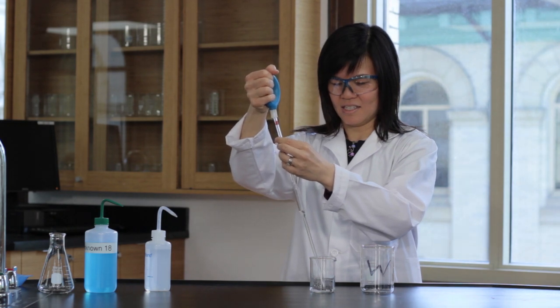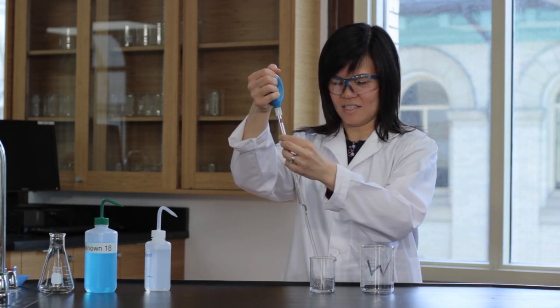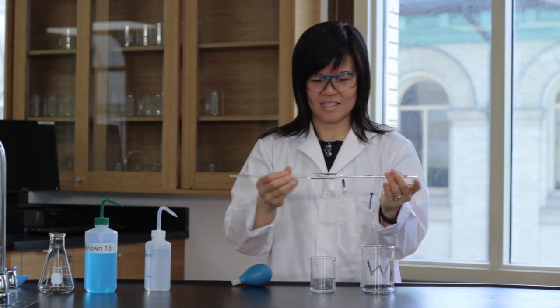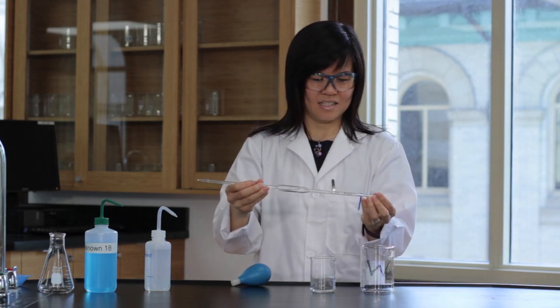Draw water into the pipette until it is about half full. Rotate the pipette so that the entire middle region is repeatedly coated with water, avoiding wetting the top end. Tip the pipette back to vertical position and let the water drain out.